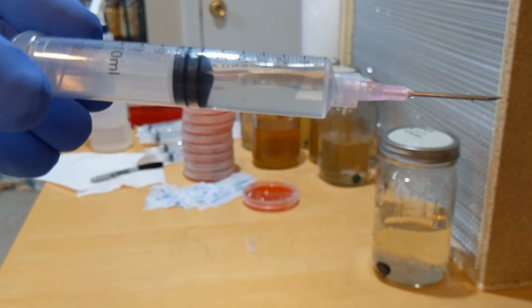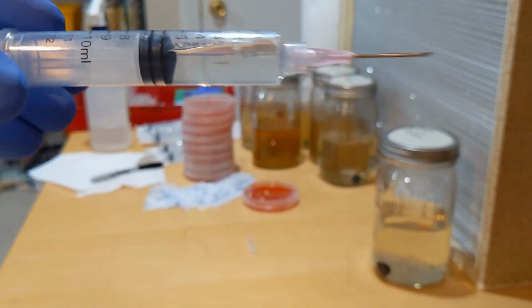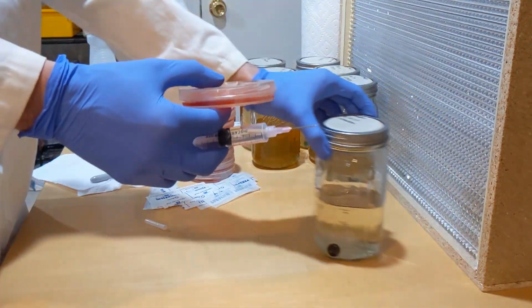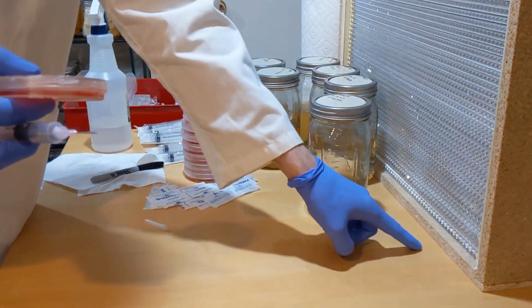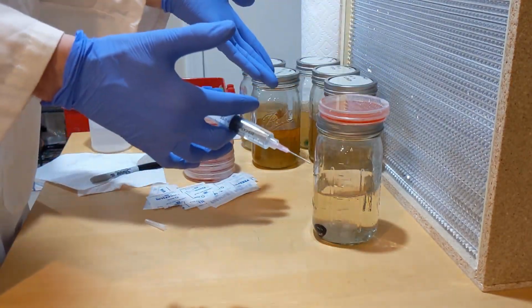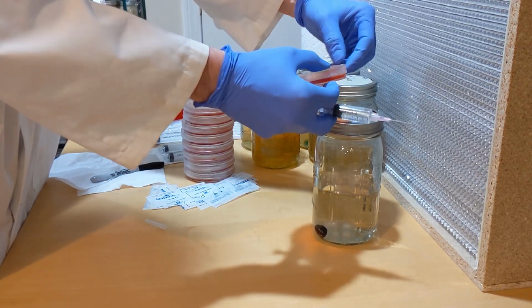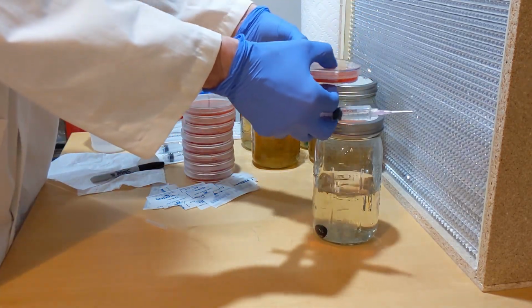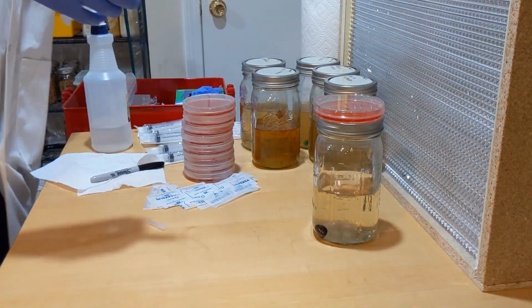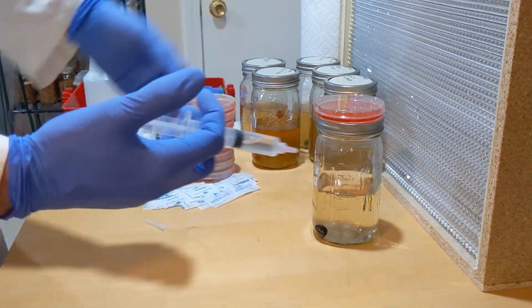See, there's a couple pieces of mycelium in there. And we're going to drop that on the plate. So again, because of that little board right here, I'll grab the jar I have and I'll work on top of it. And I like to make my agar colors sometimes. It's just fun.